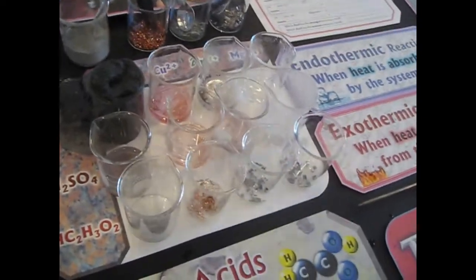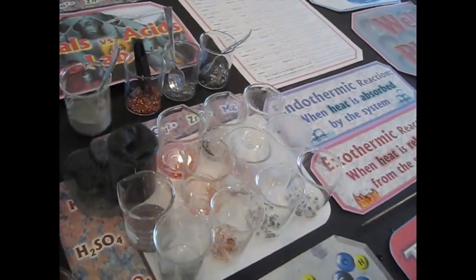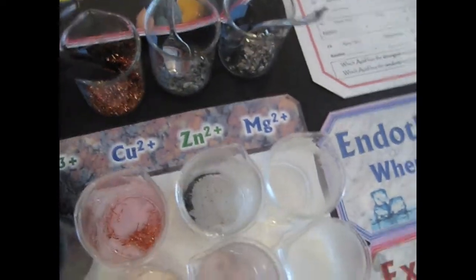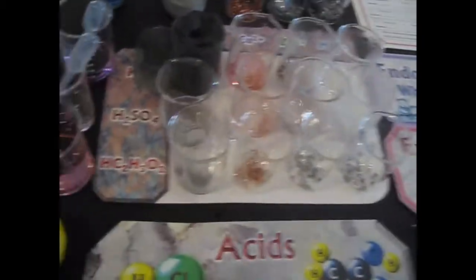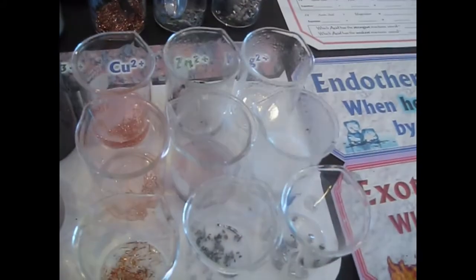Okay, what about the zinc? Didn't the zinc start quickly last time? Yeah, not this time. Is the zinc going? Oh, a little bit. Do you see any more red color left in these? I do after this. Where's the magnesium? Look, where's the magnesium? Oh yeah, there's that nasty smell.